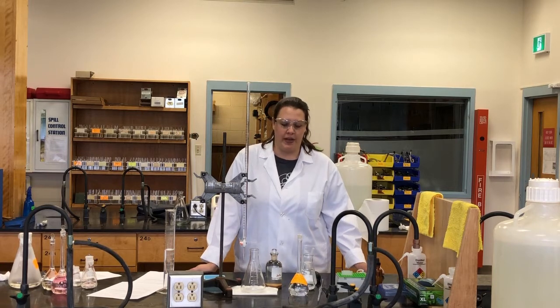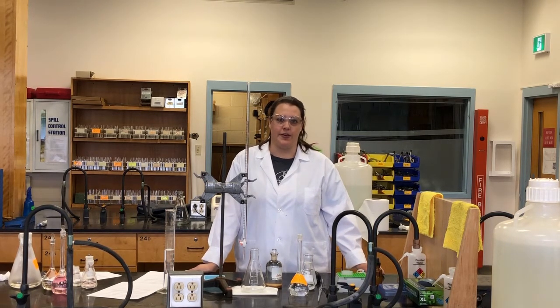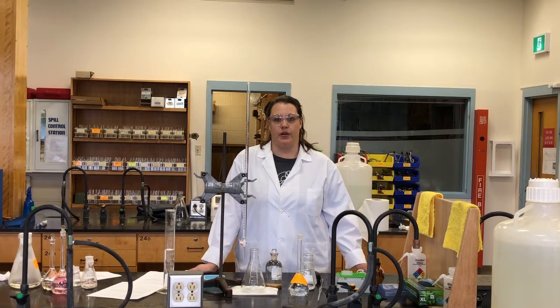So you're going to compare the values of oxygen content that you received in the first lab for dissolved oxygen to the results that we get in this lab for BOD, and that will allow you to look at the differences between the two and how they change after that 5-day incubation period. So the procedure is the same as I already mentioned. So we're going to start again with standardization of our sodium thiosulfate, and then we'll move on to our sample analysis.